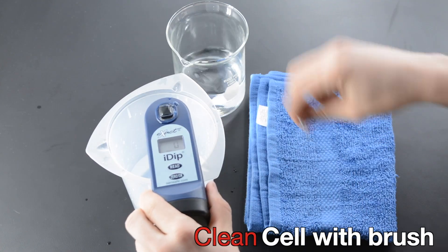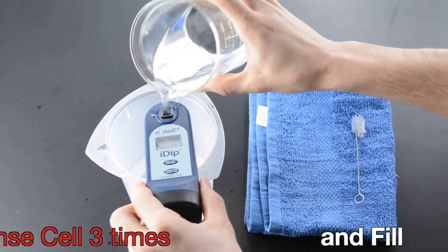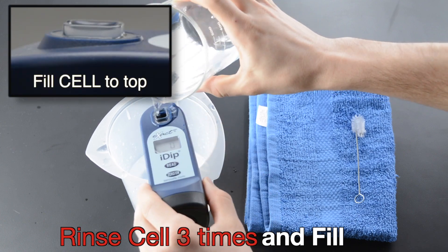Clean the cell with a brush. Rinse the cell three times and fill it to the top.